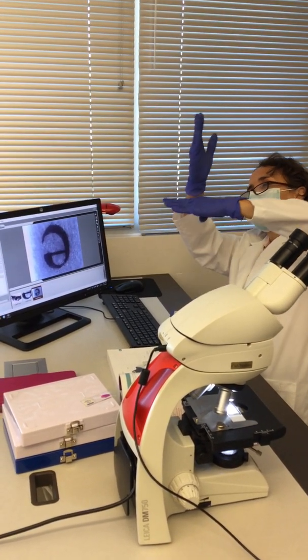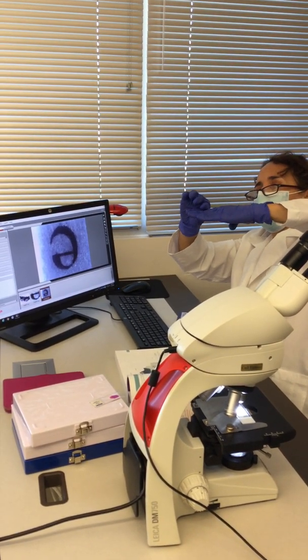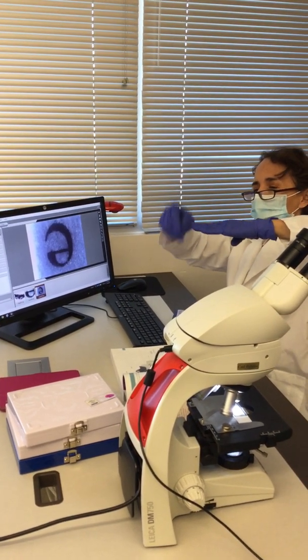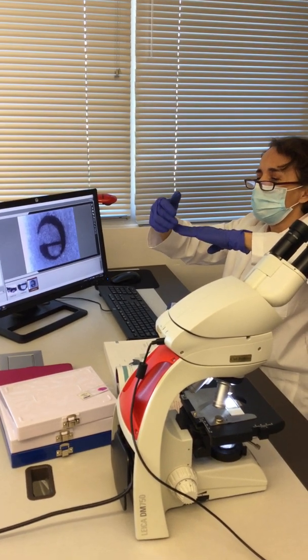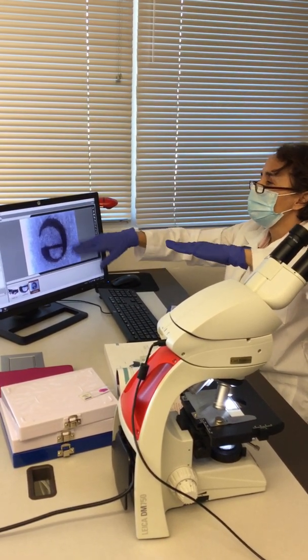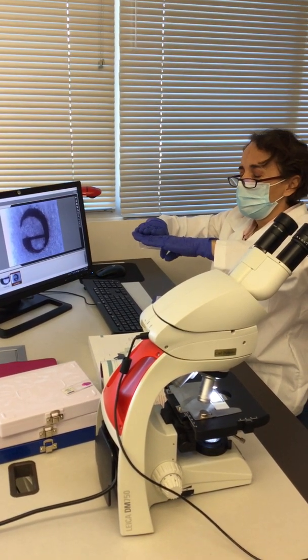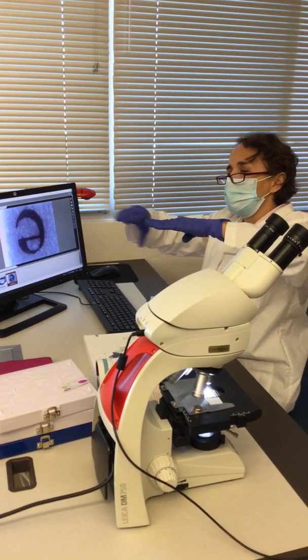Whenever the light is passing through a flat sample, you don't have to adjust anything on the fine or coarse knob besides just looking at the definition that looks best, because at some point everything is at the same level, at the same plane.